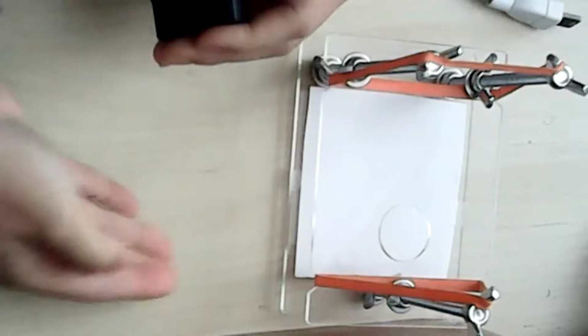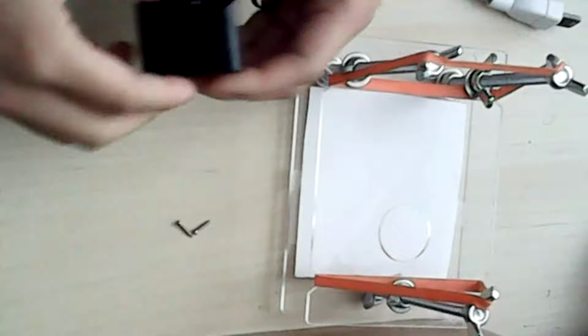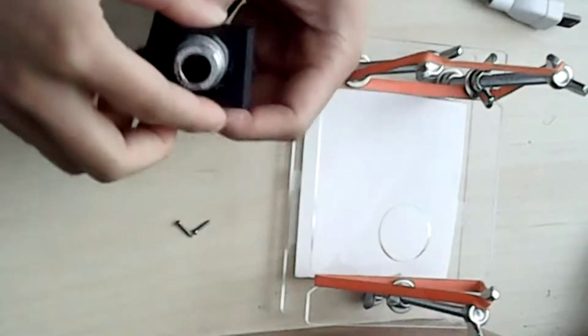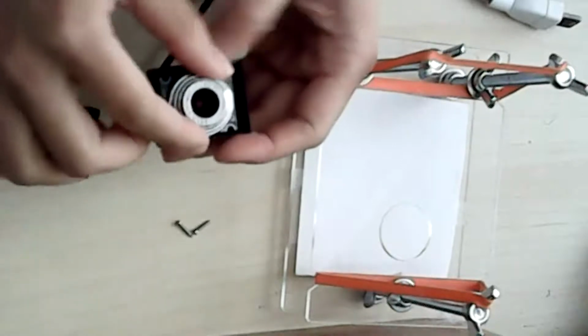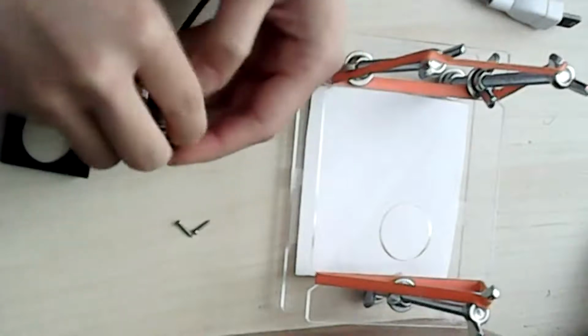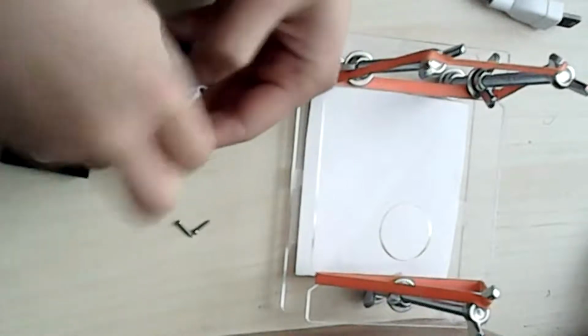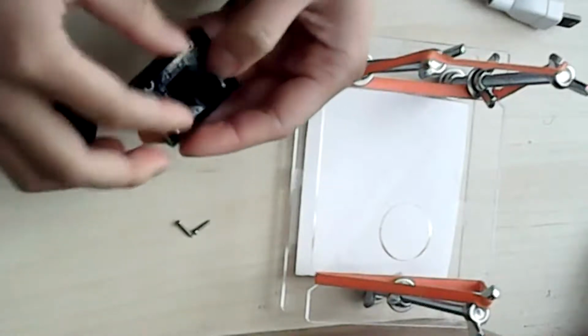Make sure you don't lose the 2 tiny screws. What you can do, once that is unscrewed, then it comes apart. And then you can just pull this off. You don't really need to twist it. Gently pull it off. And then, yeah, we're good.